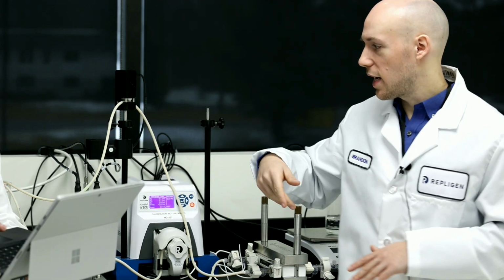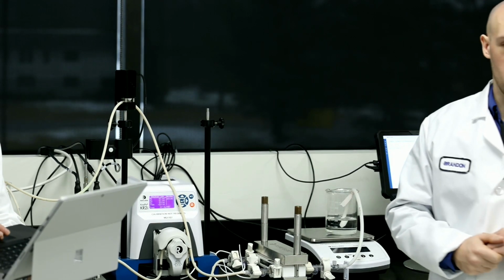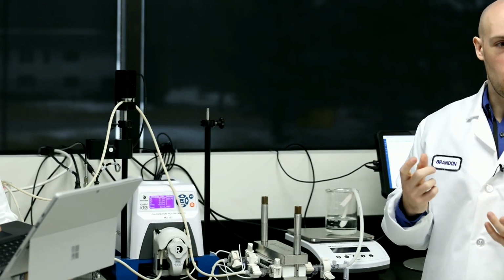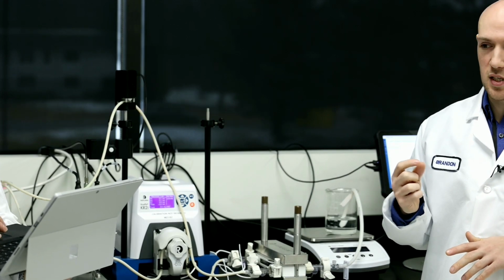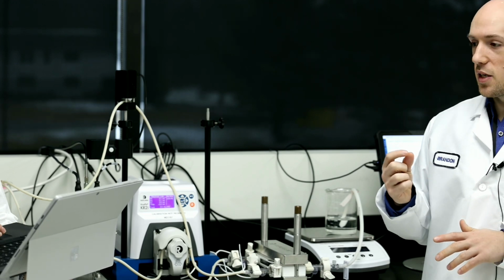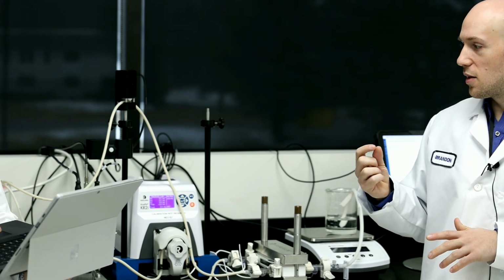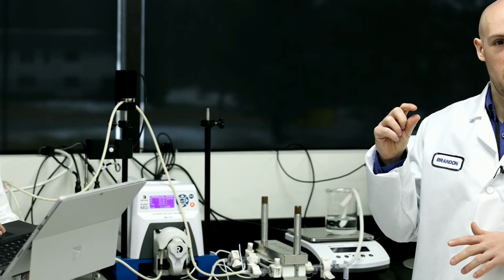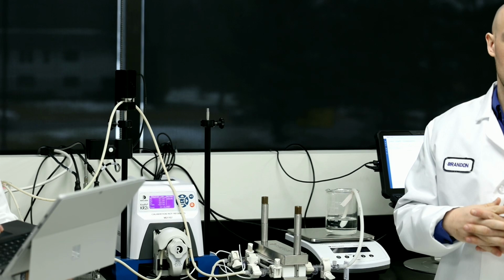So if I start at 25 mgs per mil, the back pressure valve is going to close to say about 35 to 40% of the way, until it's touching the tubing, until it gets to 10 psi. And as I get concentrated, the pressure goes up. The automatic back pressure valve is going to go up and up a little bit until you get very concentrated, let's say over 200 mgs per mil.